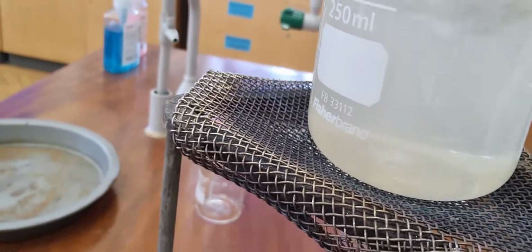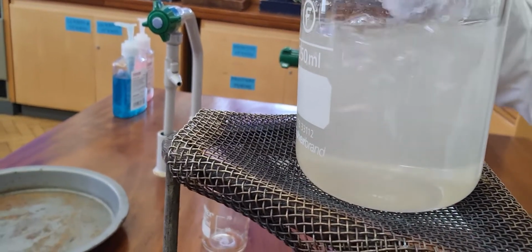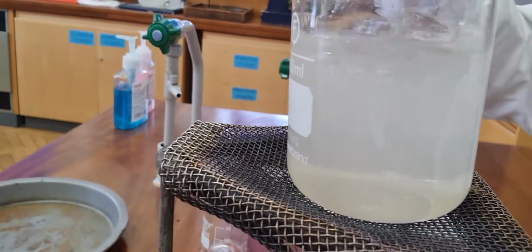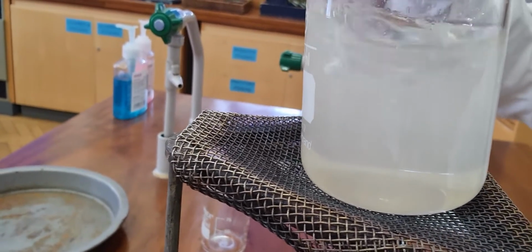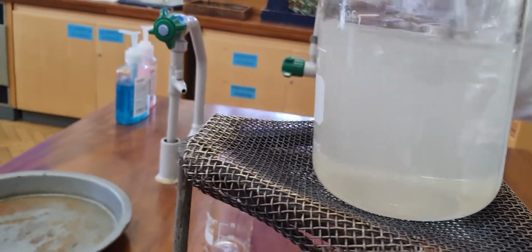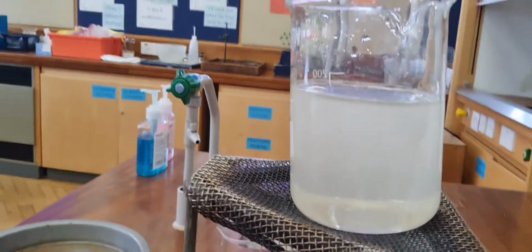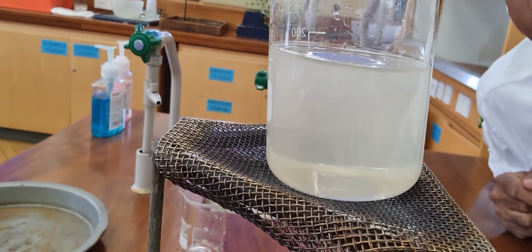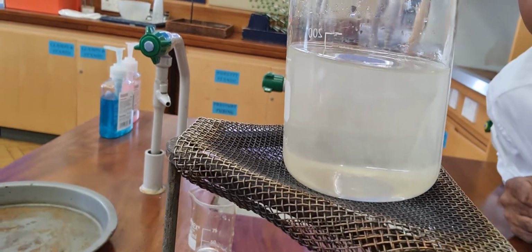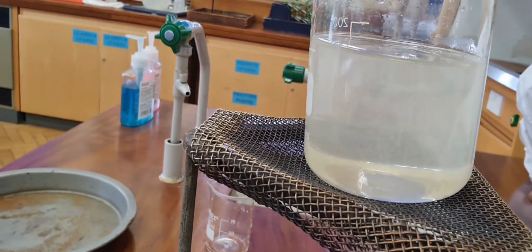The Bunsen burner will be warming up the water to make this happen faster than it would do otherwise. Speed it along. But then I have to stop stirring to see if it's dissolved. And there, if I stop stirring, the air bubbles I've introduced might leave.